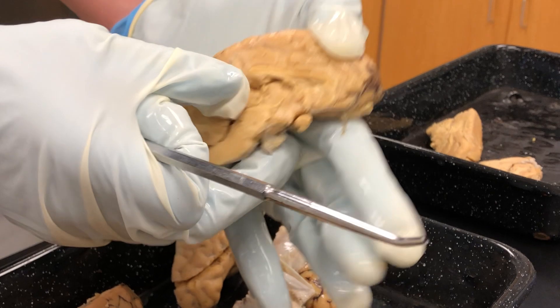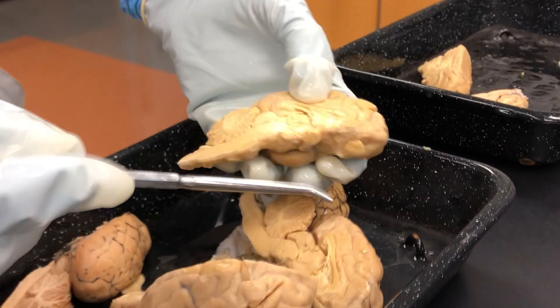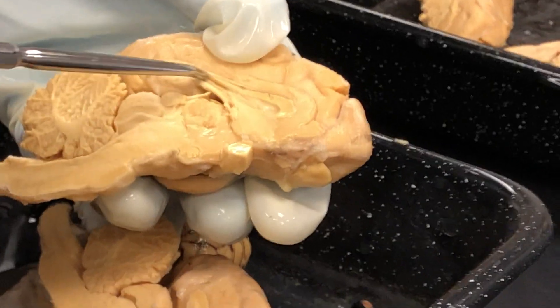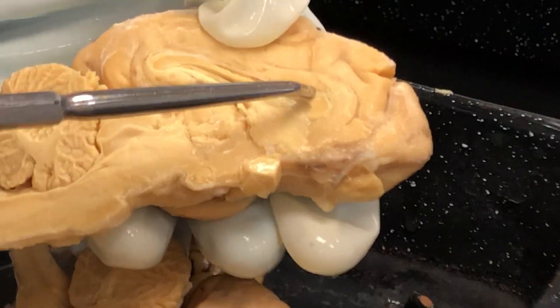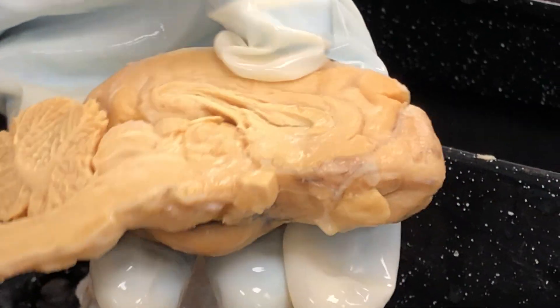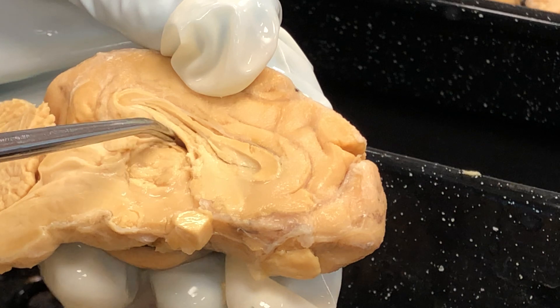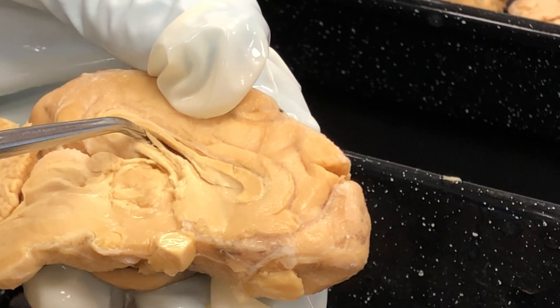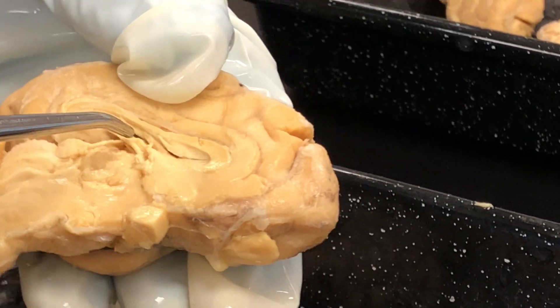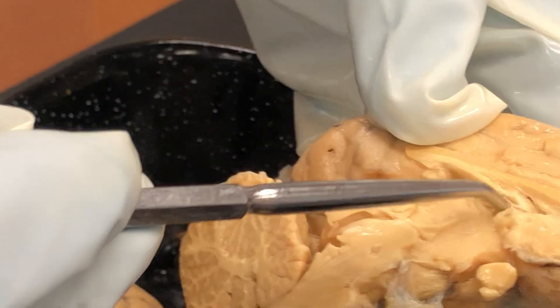Moving to the mid-sagittal view, the first structure is the corpus callosum. The corpus callosum is this white matter tract that you see here — this is part of the corpus callosum. Then we have the fornix. The fornix is on the underside of that, below it — it's also a white matter tract. Usually they're not intact on these brains, but here it is, and you can see it a little bit here as well.